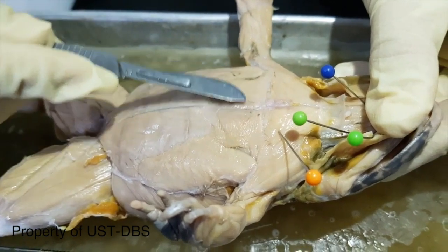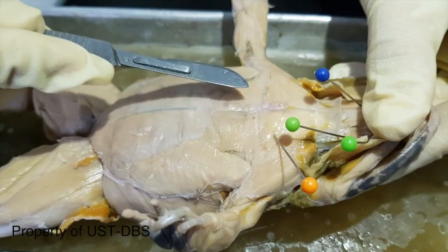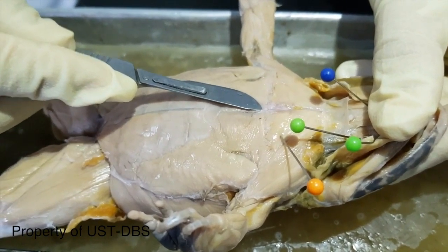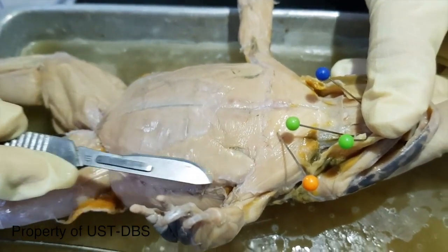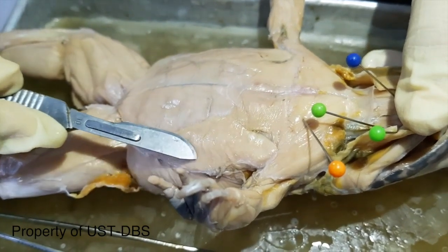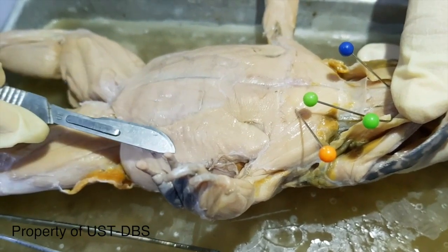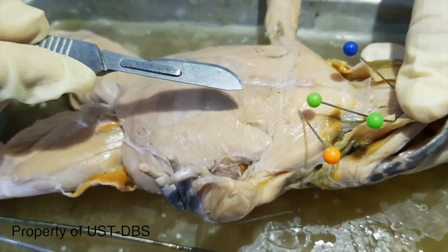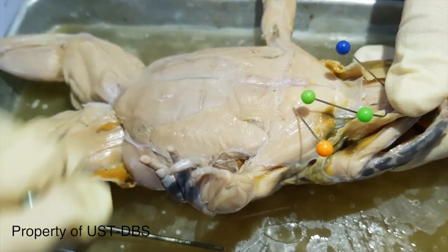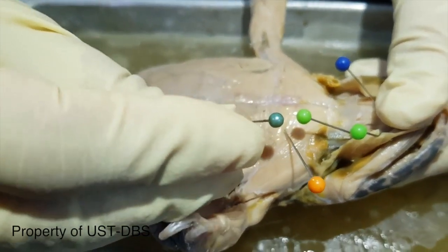This one here is the anterior pectoralis, but in the manual it says cutaneous pectoralis. These are the major pectoralis group, the pectoralis major, but for some it is identified as middle and posterior pectoralis. So there's anterior, middle, and posterior pectoralis, but we'll use the terminology cutaneous pectoralis and pectoralis major.